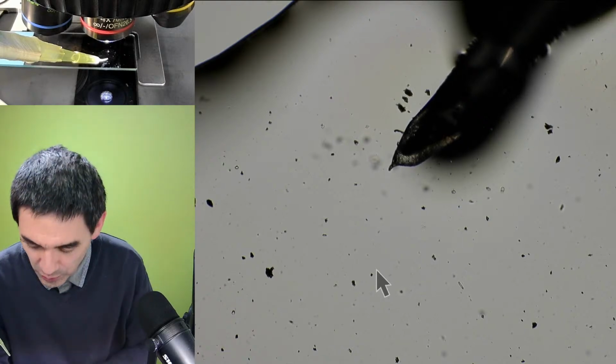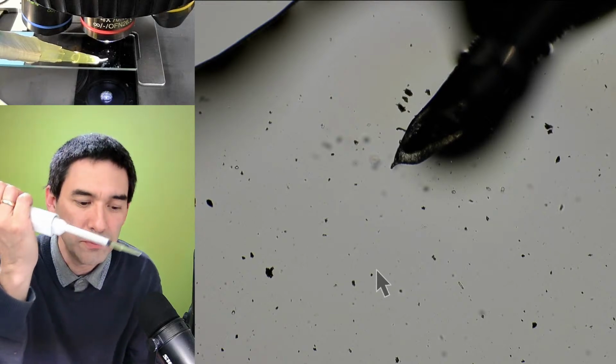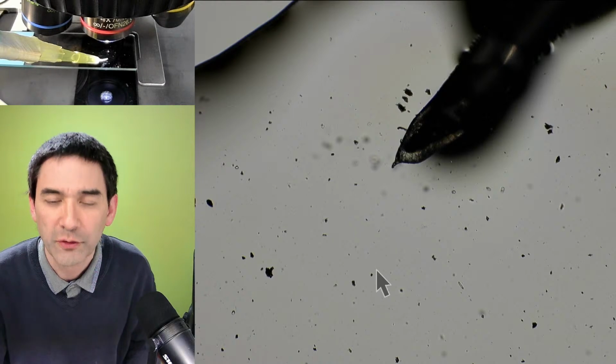And then whether or not you want to play around with a tube, an air tube, or whether you want to use a pipette, or whether you want to use something, maybe a disposable one, that's a different question.